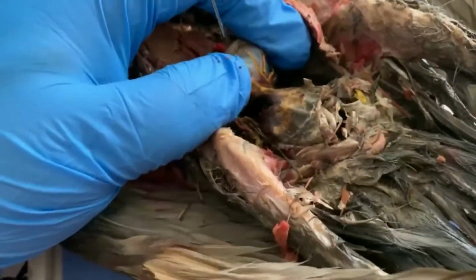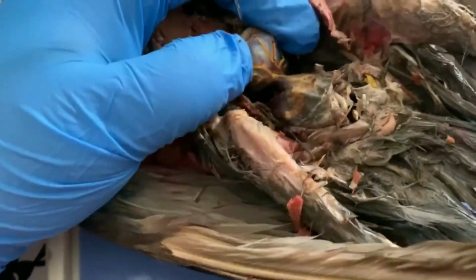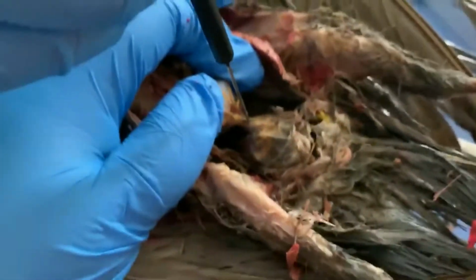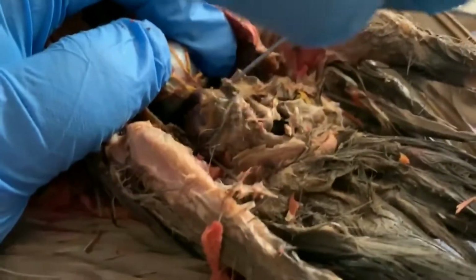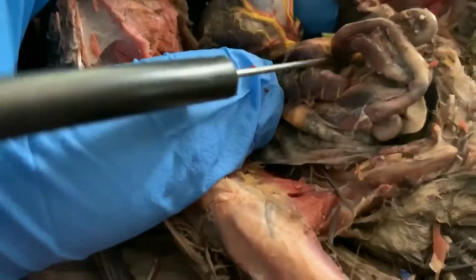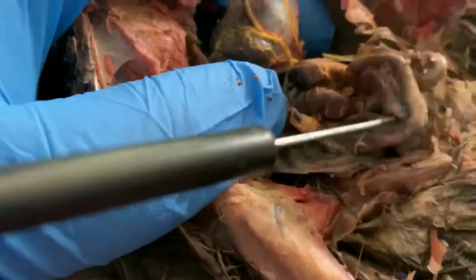That makes this really, really kind of hard. Okay. We have the intestines. If you can kind of break into the mesentery there, Ava. See if we can see the individual parts of the intestines here. All right, so we've got these long tubes, the smaller ones being the small intestine, and it gets thicker down there where it grows into the large intestine.